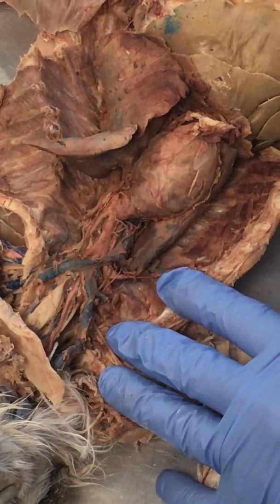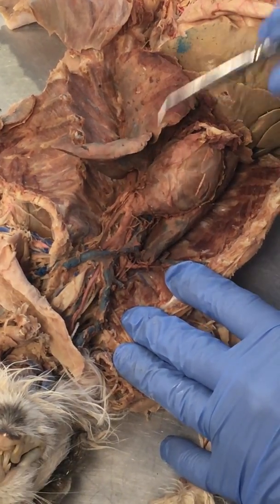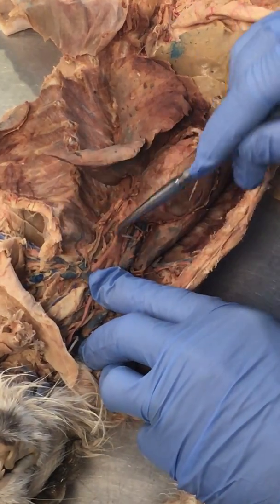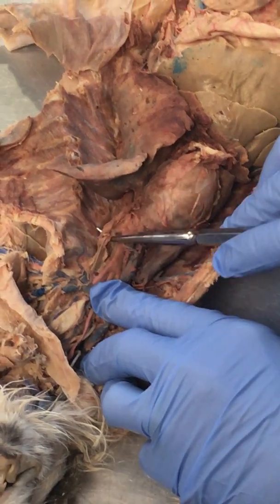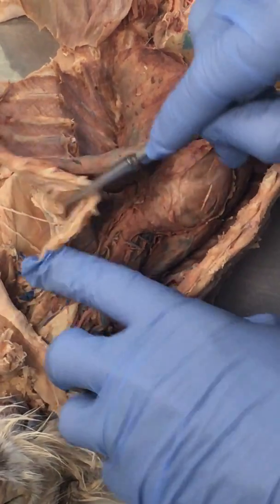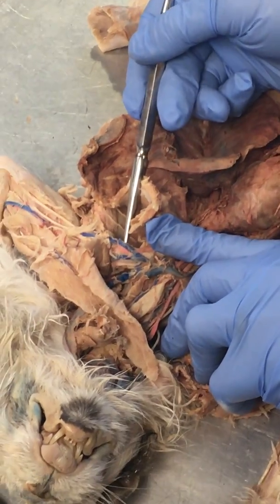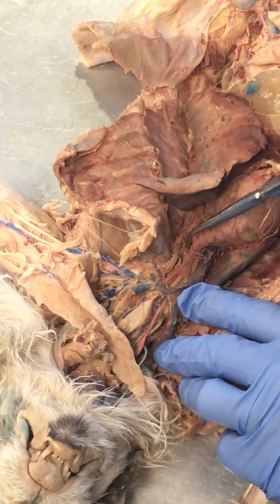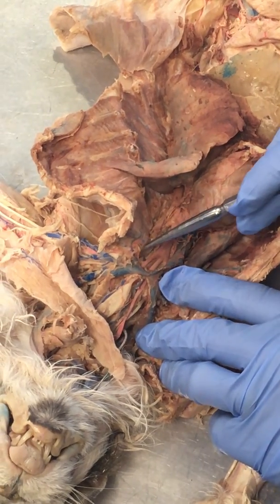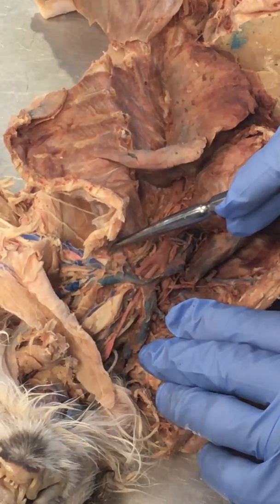So then the next thing you have is left subclavian, right subclavian arteries. The way we do this, we say, here, this is going to be the subclavian. You can see it on the left-hand side going up, and it's going to swing around just above the rib here, and then go out into the upper extremity. You can see the red right there. So here we're going to call this the subclavian. It means underneath the clavicle, but it's labeled the subclavian until we get past the first rib.